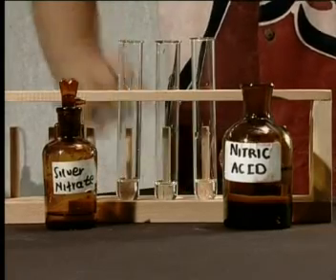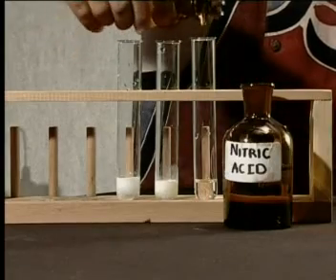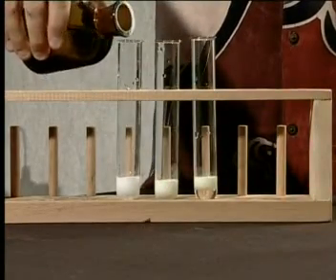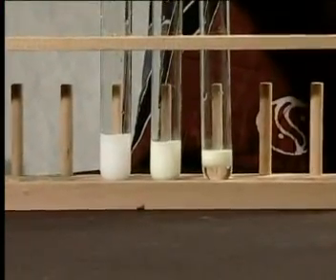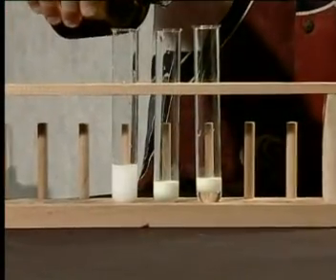We need to place a little of each halide in a test tube, and then add a few drops of silver nitrate solution to each test tube. After a few minutes, add a few drops of nitric acid to each test tube. Look carefully at what happens in each of the test tubes and take note of what you see. In each case, a discoloration was observed. This was due to the formation of a precipitate. You can see how the color of each precipitate varies. The precipitate did not react when nitric acid was added — that is to say, the precipitate is insoluble in acid.